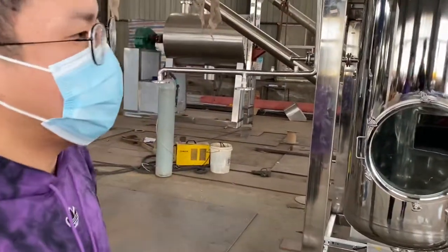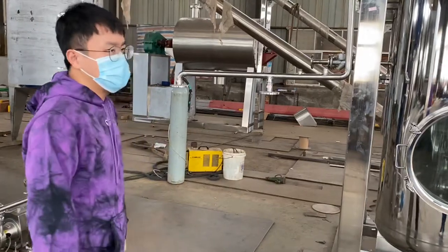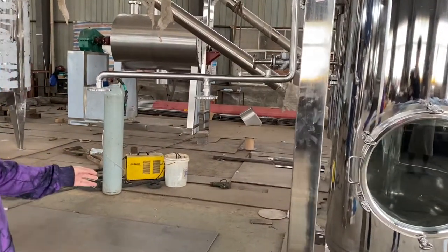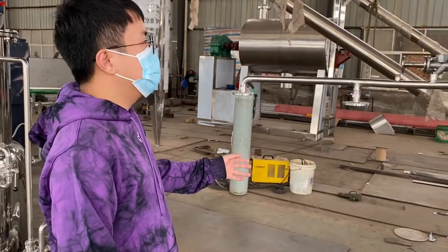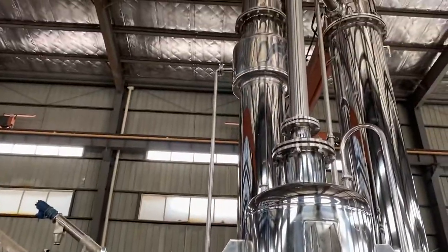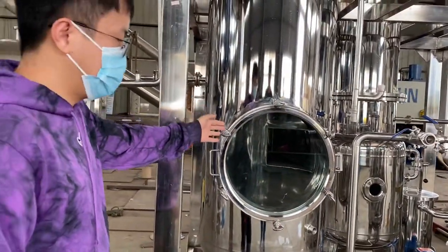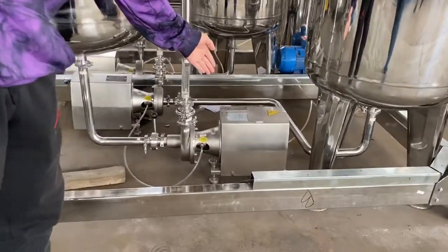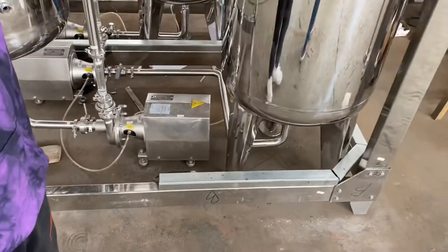Hello, this is a single-effect falling film evaporator, and now I will introduce some details for you. This is the steam oven, and this steam oven is heating the evaporator. This is the evaporation chamber. This pump is the circulating pump, and this is the material tank.